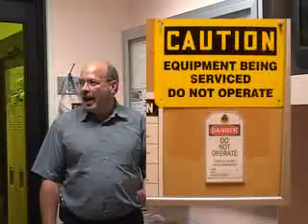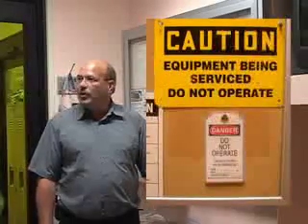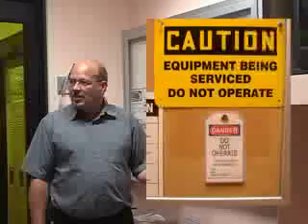To talk more about lockout, tagout for you as a user: anytime you see this placard or these types of placards that say do not operate or caution the equipment is being serviced, it's very important that you respect that. This is to stop service personnel from getting injured due to a user trying to energize a tool. So lockout, tagout is implemented here, and we will lock out a tool and lock out the power source and typically place a placard like one of these on the tool.